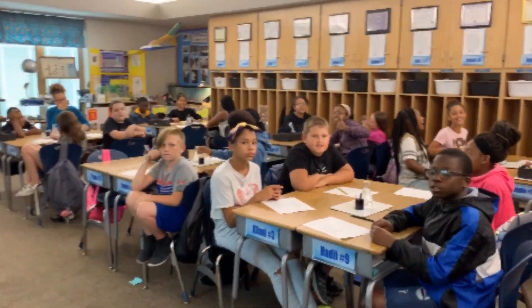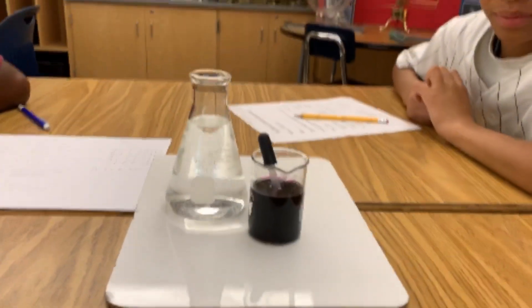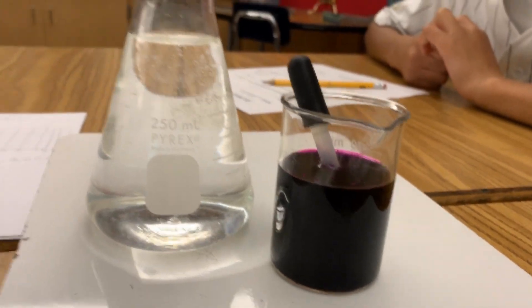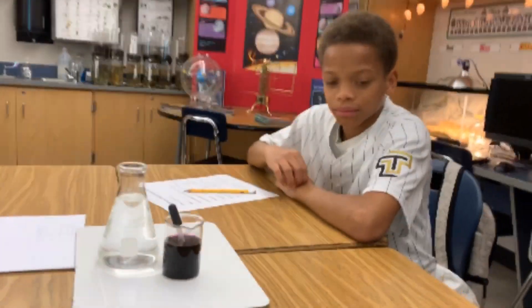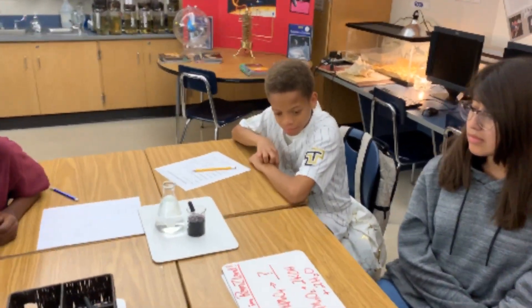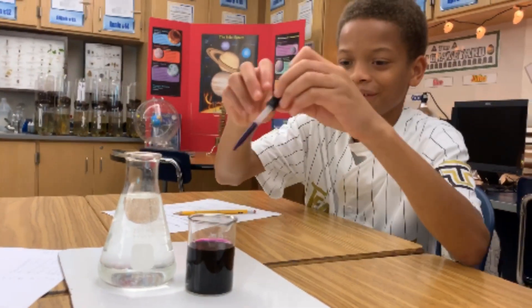We're learning about reduction reactions today and we're using potassium permanganate and 3% hydrogen peroxide. Over here we've got a beaker with dissolved potassium permanganate and in the flask we've got 3% hydrogen peroxide. The essential question this lesson is: where does the color go? Because right now it's bright purple. Take a drop and add it to your hydrogen peroxide and let's see what happens, drop by drop.